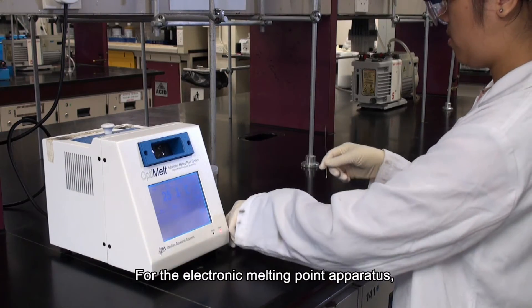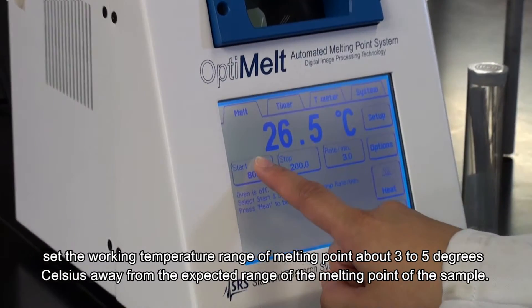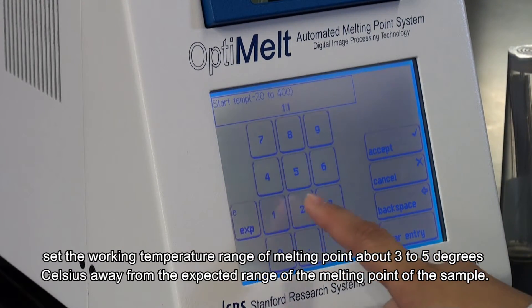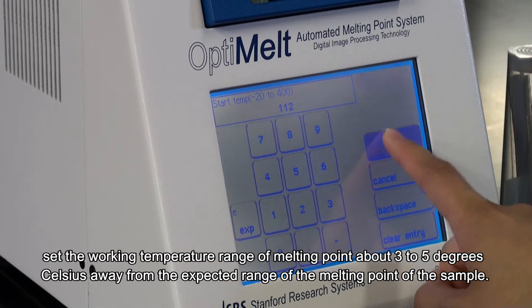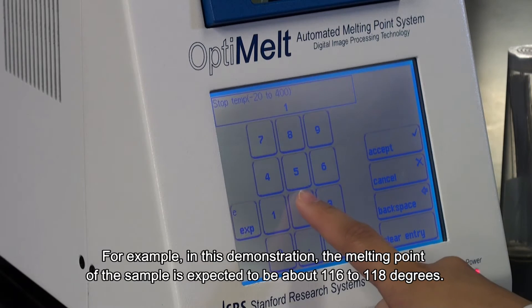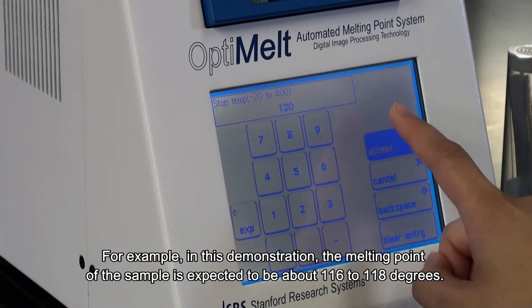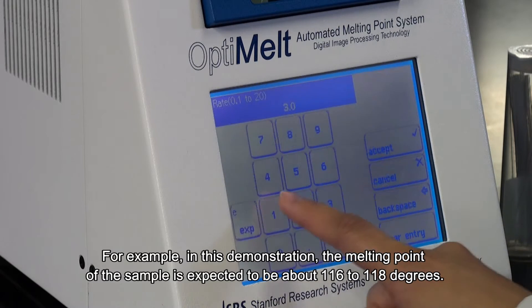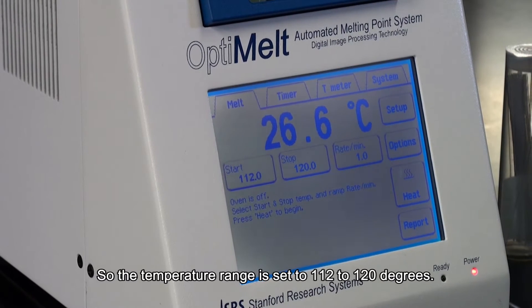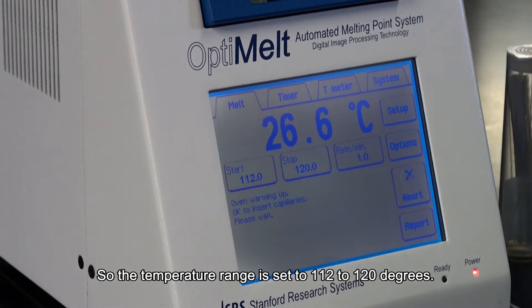For the electronic melting point apparatus, set the working temperature range on the apparatus. The starting point should be about 3 to 5 degrees Celsius below the expected melting point of the sample. For example, in this demonstration, the melting point of the sample is expected to be about 116 to 118 degrees, so the temperature range is set to 112 to 120 degrees.